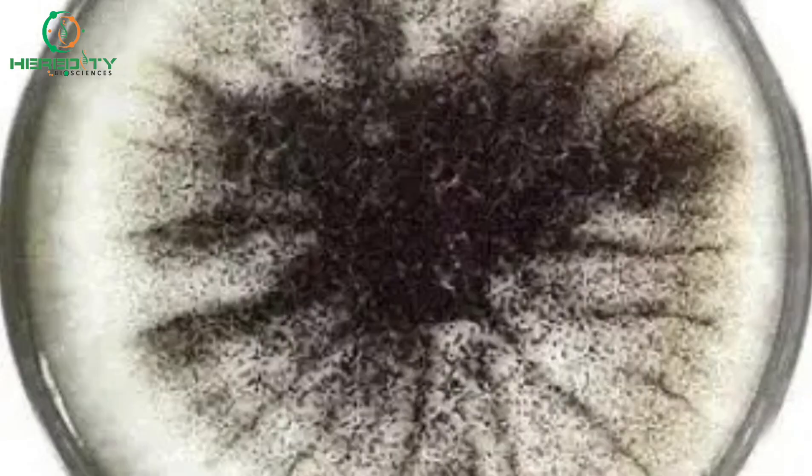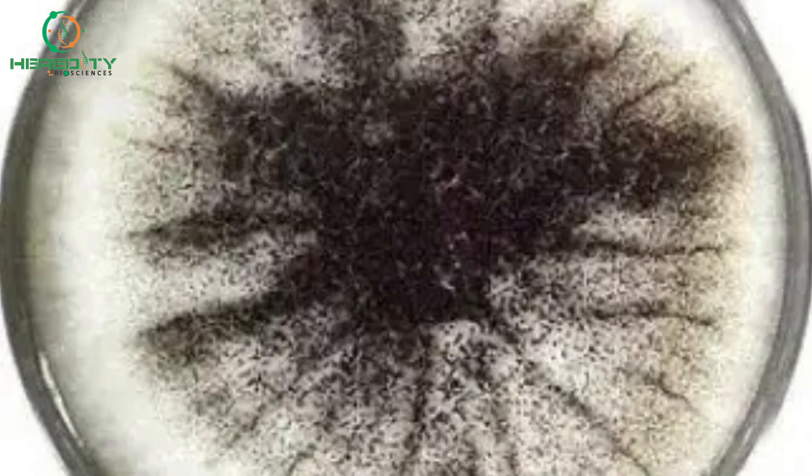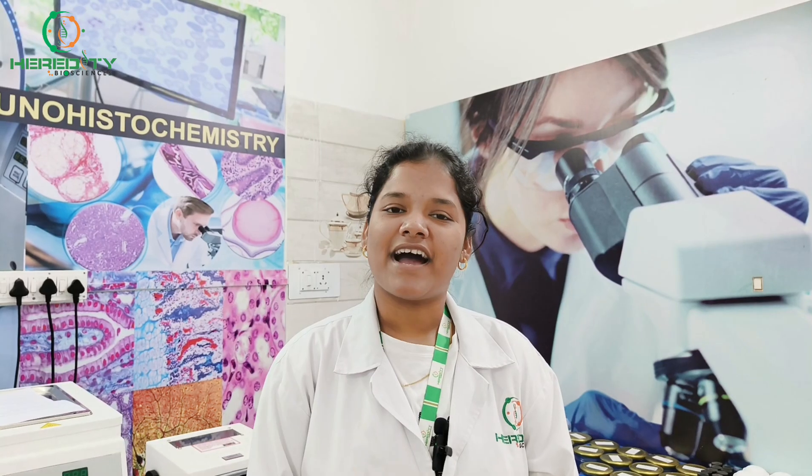Sabouraud Dextrose Agar is a specialized medium primarily used for the cultivation of fungi. Its unique composition inhibits the growth of bacteria and provides an environment for the growth of fungi. It was derived by Dr. Raymond Sabouraud. Now let's move into the main part, the composition and the preparation of Sabouraud Dextrose Agar.